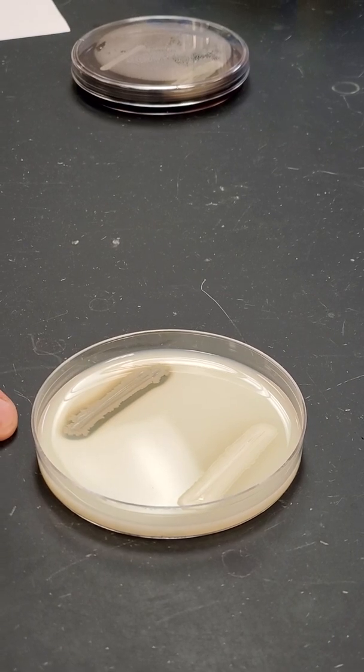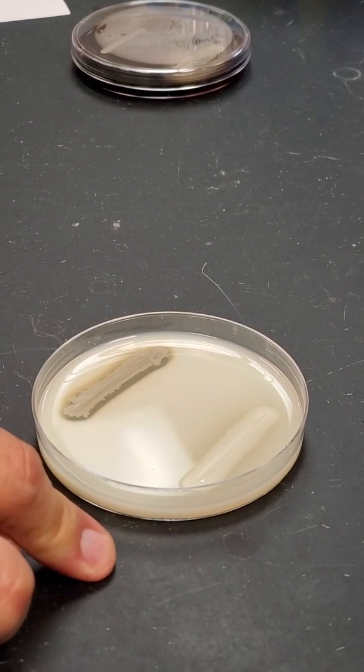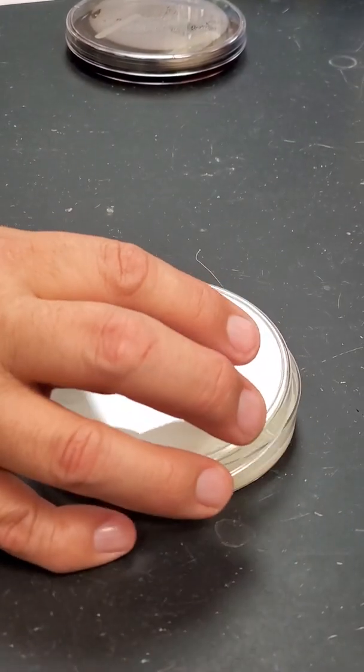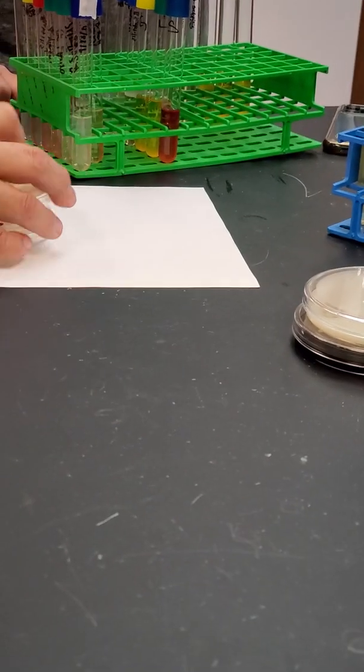But anyway, so this one's positive, that one's negative. Okay, breakdown of casein. And then my favorite place is not here. Where is it? These are examples of skim milk.